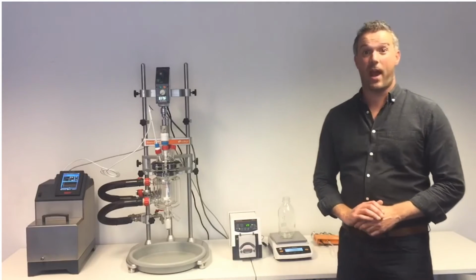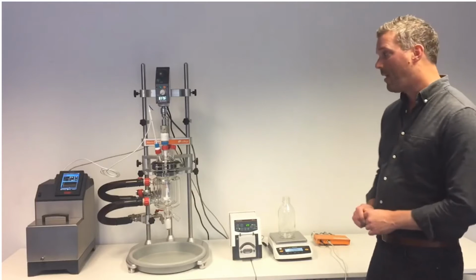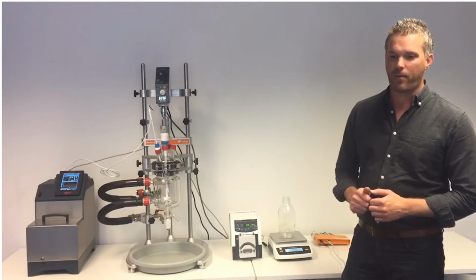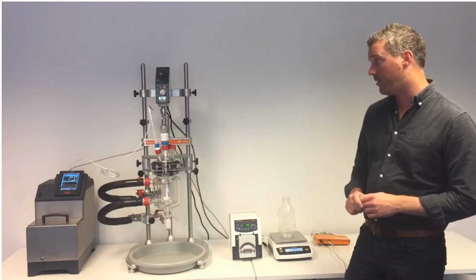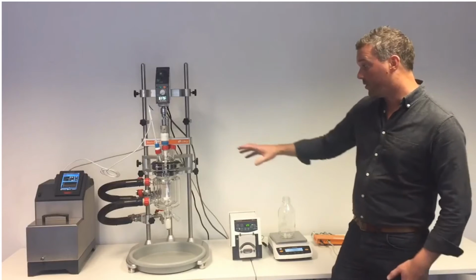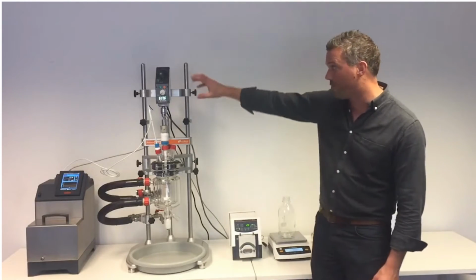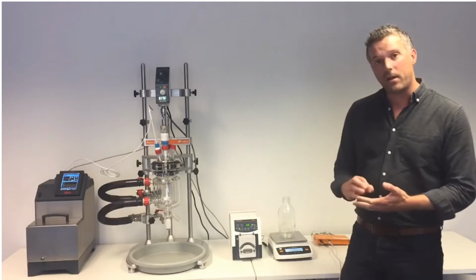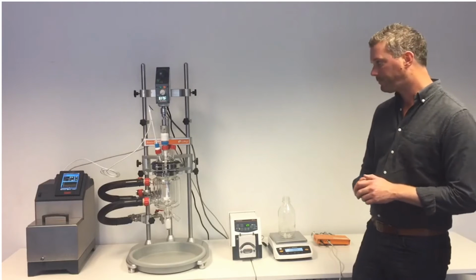So today I want to show you how you can hook up your reactor to our AVA software. Some of the primary reasons for using AVA software might be if you have a particularly long or complicated experiment that you don't want to wait next to, or if you want to control multiple devices like a pump, a temperature controller, a stirrer, a balance, maybe pH, or it could be that you just want it to automatically data log and record your results.